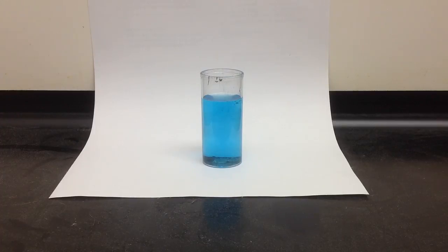And that's because when we dissolve it in water, we can split apart our compound into its charges. So our CuCl2 would split apart into copper as well as into chlorine. This demonstration shows that separation process.